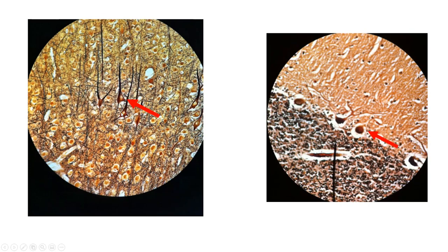Some more microscope slides. These are pyramidal cells. They look like little triangles. Think pyramid triangles. These are found in the cerebral cortex of the brain. And if that doesn't make any sense to you, it's fine at the moment, because we'll cover the brain in the next chapter. So pyramidal cells are found in the cerebral cortex of the brain. Then these are Purkinje cells, not Purkinje fibers. Purkinje cells are found in the cerebellum of the brain. Again, if that cerebellum word doesn't make sense to you, it's just a part of the brain. So just know that these Purkinje cells are found in the cerebellum of the brain.